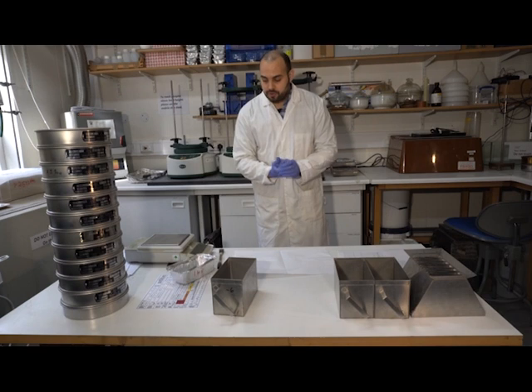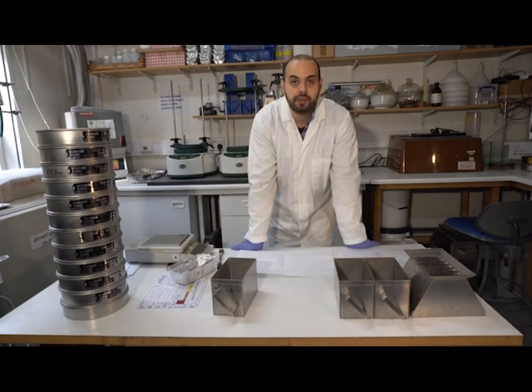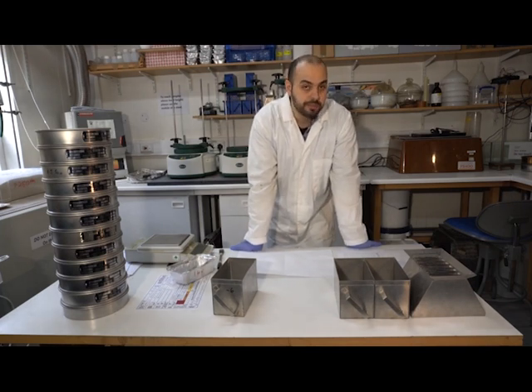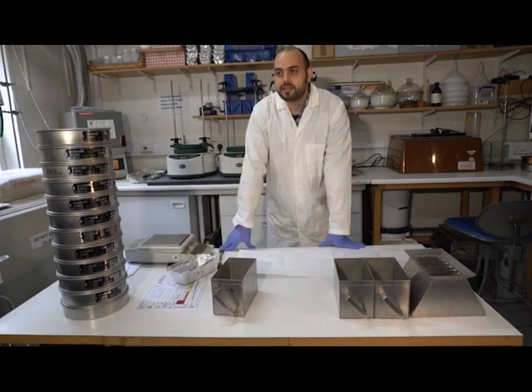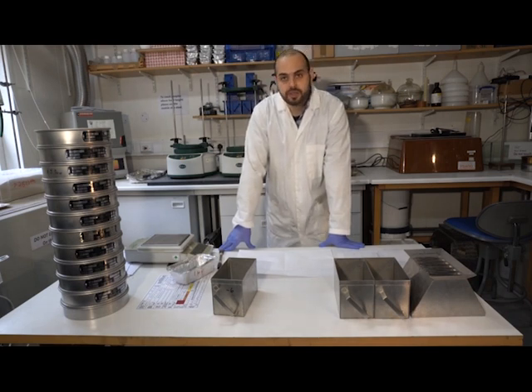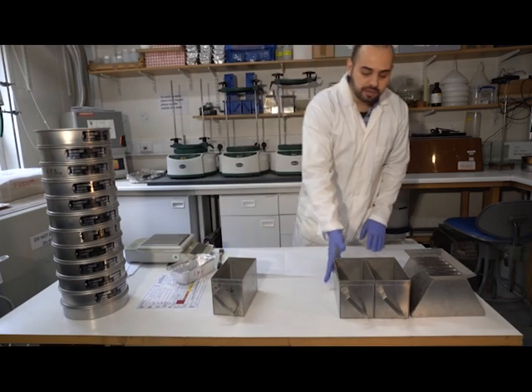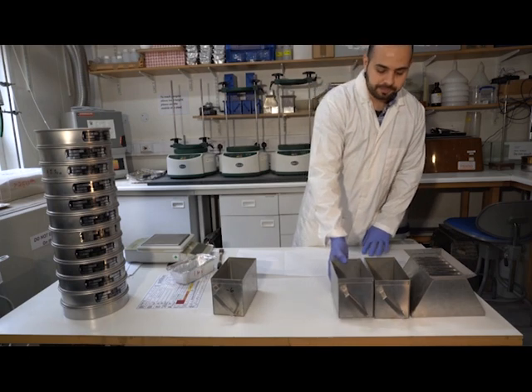Okay. So the next thing is actually to do the sieving. Now, if you read through the British standards, we are required to sieve a given amount of sediment for our analysis for sands. So if it's fine to medium sands, we want around 100 to 200 grams. If it's relatively coarse sand, you perhaps want to sieve at least 500 grams. And I reckon we have about 500 grams here.